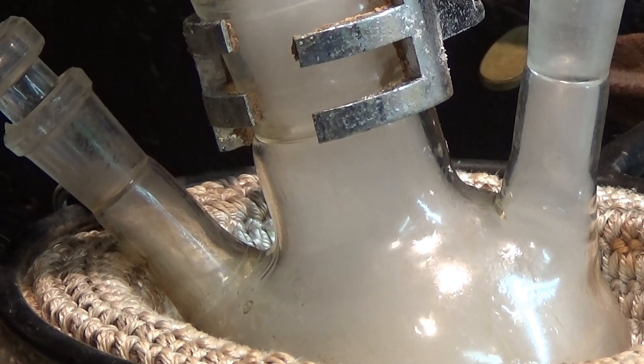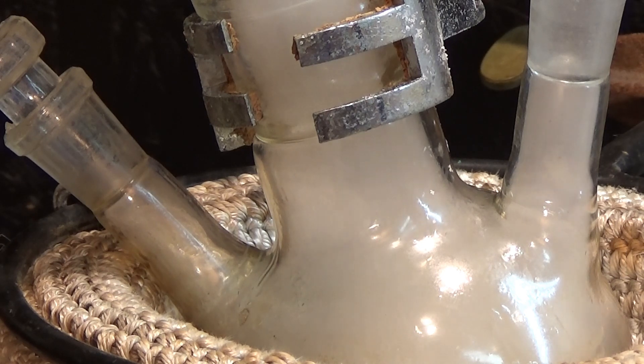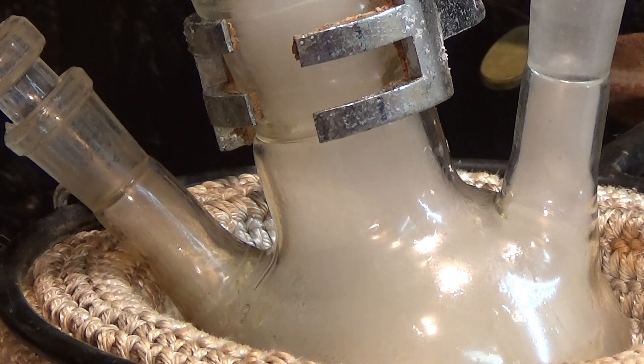All you have to do now is just keep heating and collecting the distillate. The distillate coming over will darken in color while the reaction is progressing due to the increasing heat in the reaction flask and the increasing percentage of pyrolysis compounds being formed.